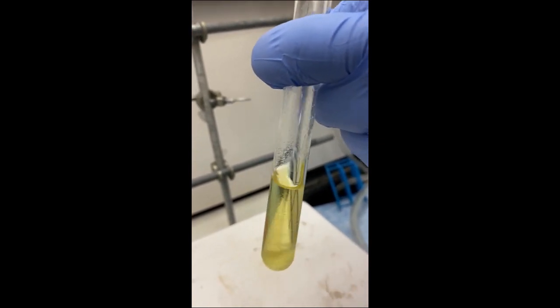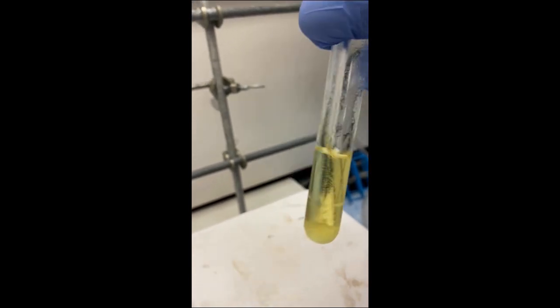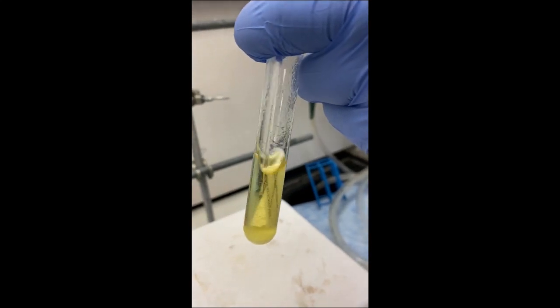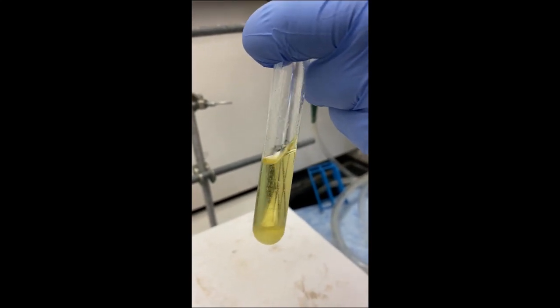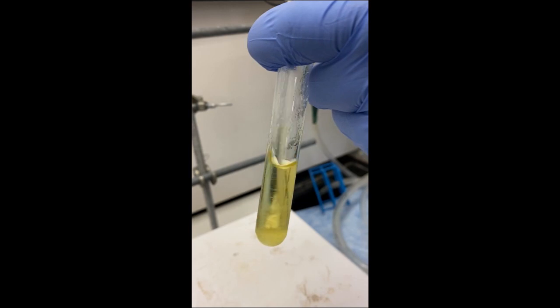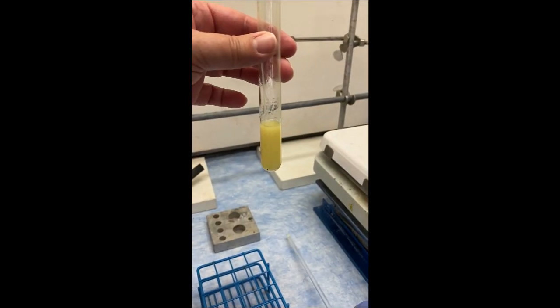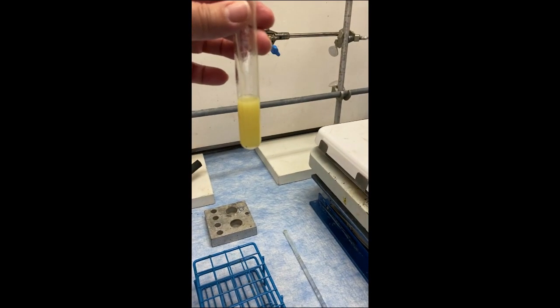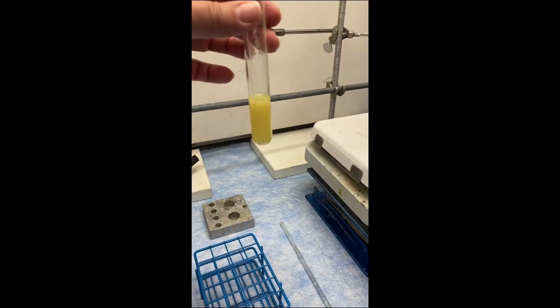This is particularly handy because our product will precipitate out and everything else will stay in solution. So when we go to filter and do our recrystallization, we're going to use those same properties. Now that we have this slurry, we're going to put it into an ice bath and let it sit.